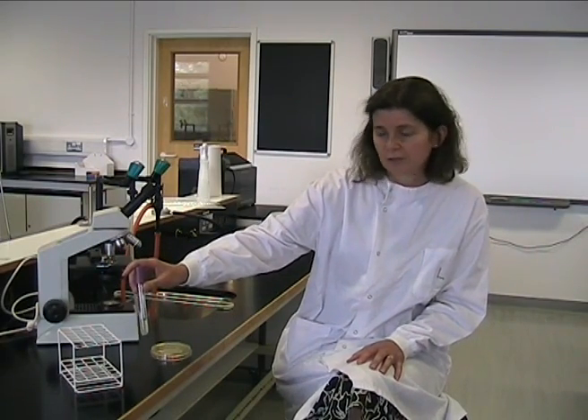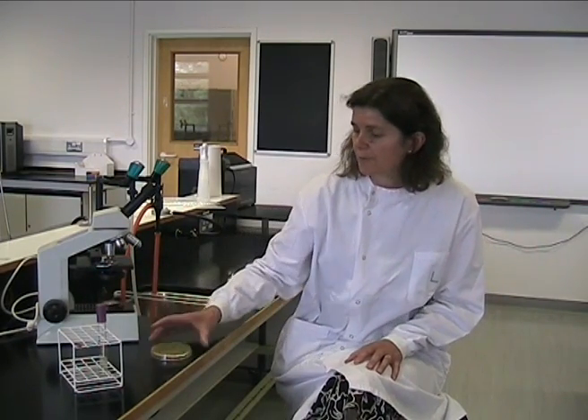We will show you staining from two different cultures of bacteria, either from a liquid bacterial culture or from the bacteria growing on a plate — an agar plate.